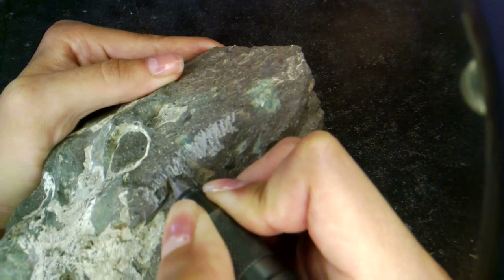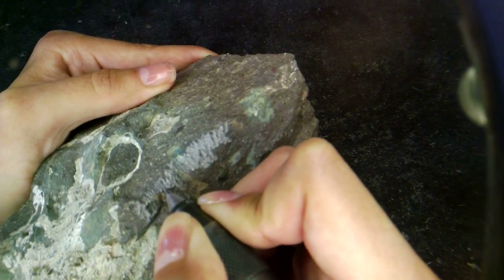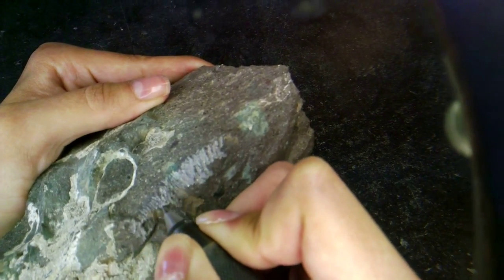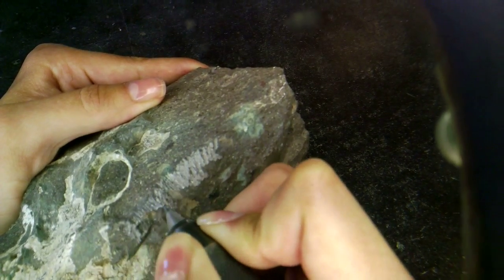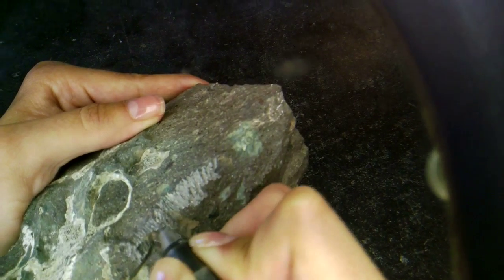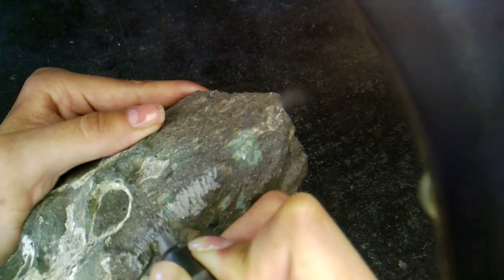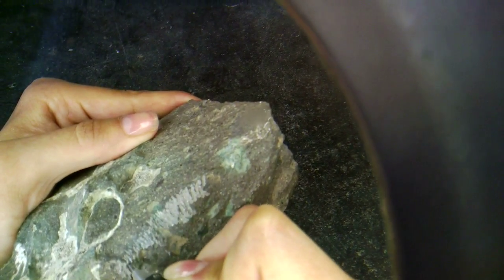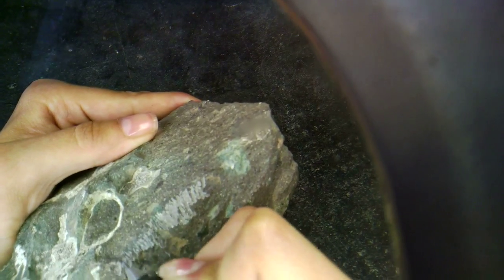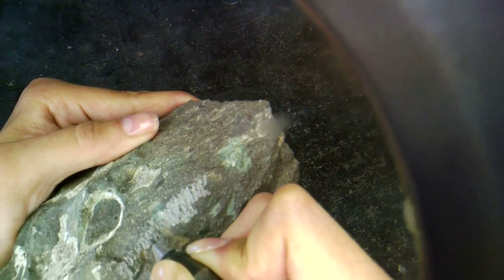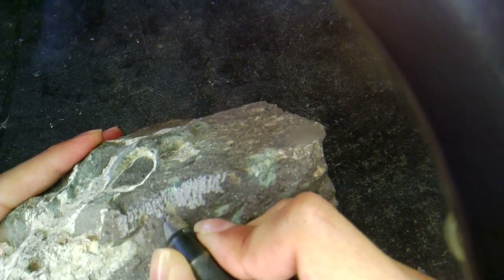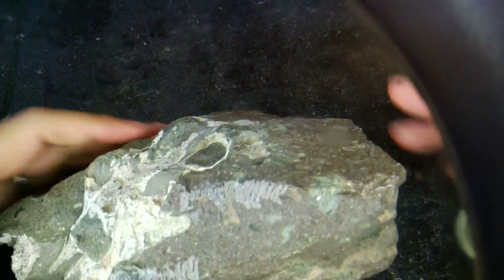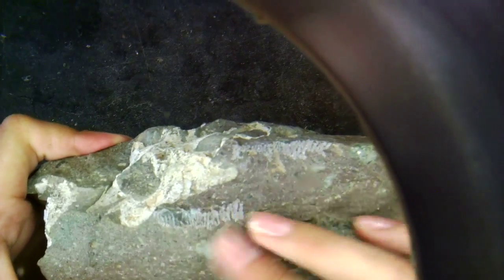So as you can see, just a little bit of that rock is coming off very, very slowly. Something like this would take me a couple of months to prepare. So if you were to come back in three months or so, we would have a lot more of this skull exposed. Hopefully, we will have found some teeth down here.